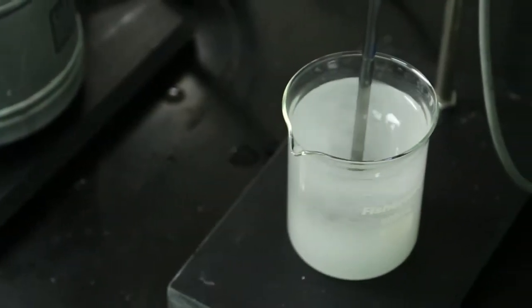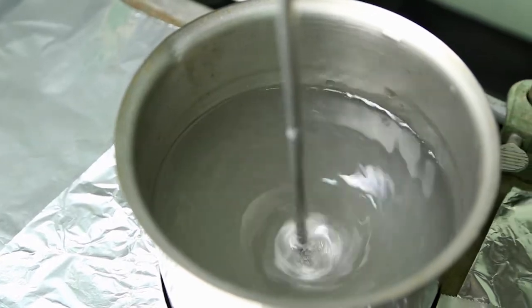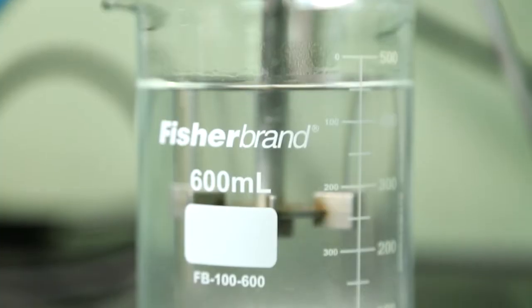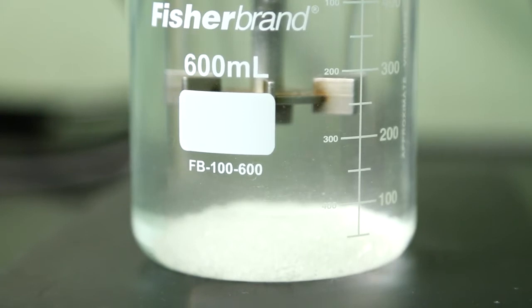Ensure proper agitation and good surface movement of the water, as the surface of some polyvinyl alcohol grades can swell quickly and clump together upon contact with water.